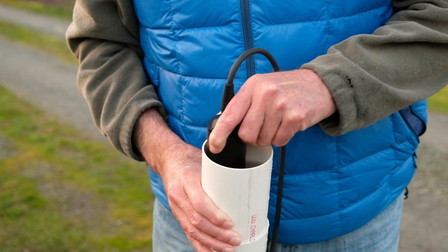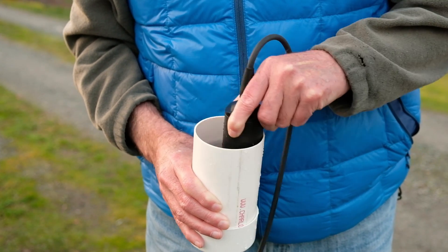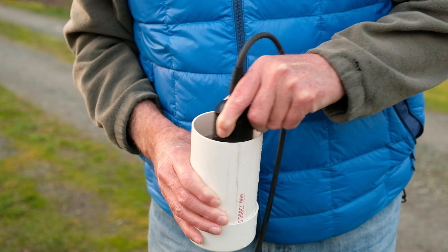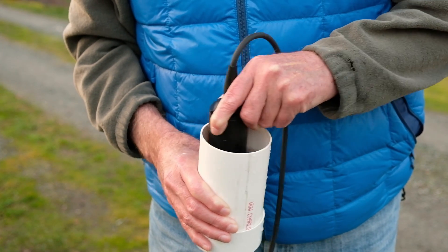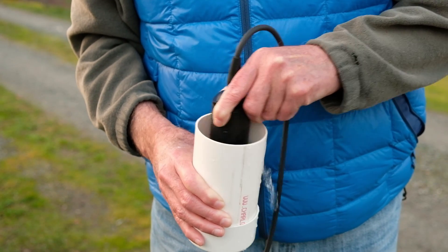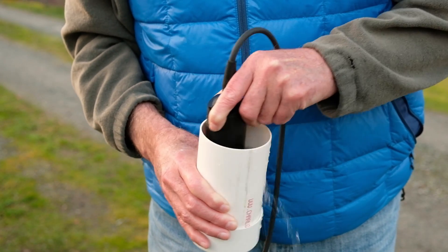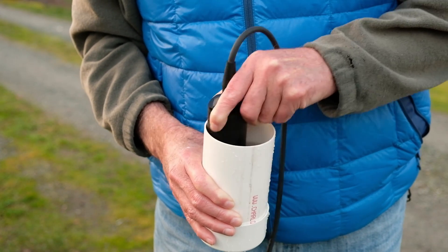And at about this pace — I'm tilting this a little bit so that you can see that I'm going around the diameter of the inside of the cup — the pace for this is twelve point three two and it's holding that number. It hops up and down: twelve point three three, twelve point three two. I'm just watching the numbers go back and forth. That's the technique.